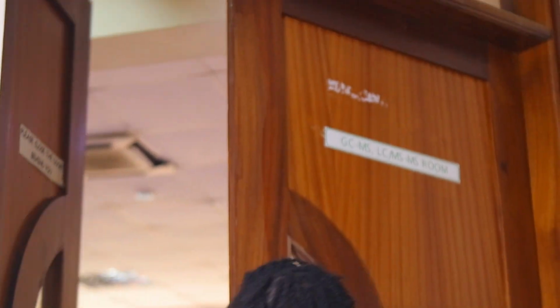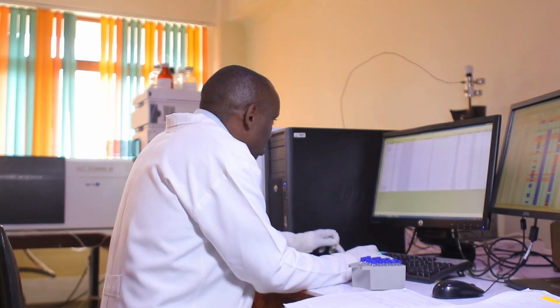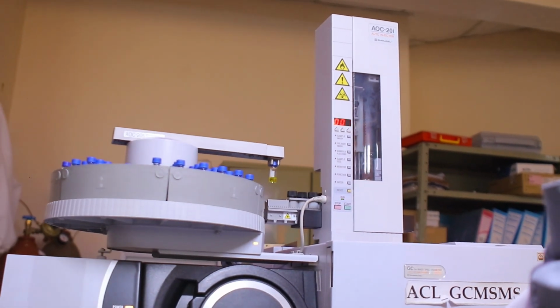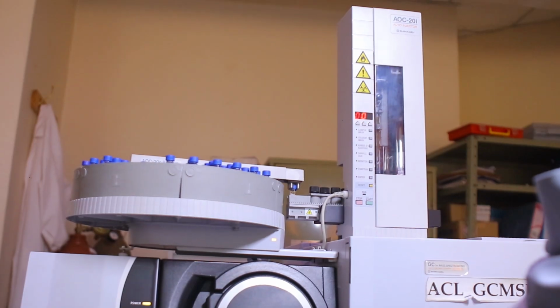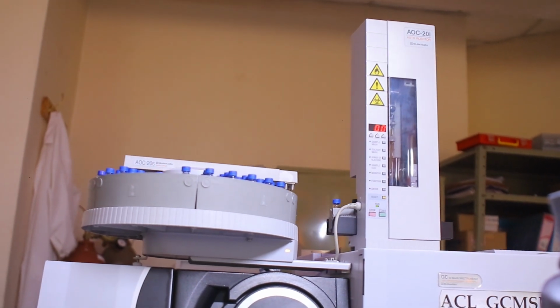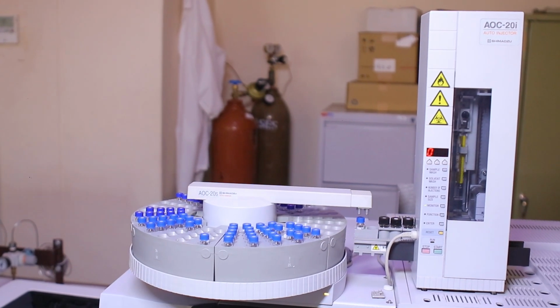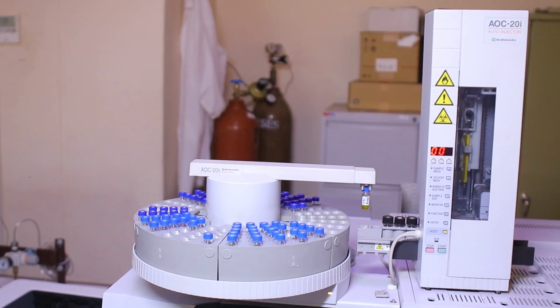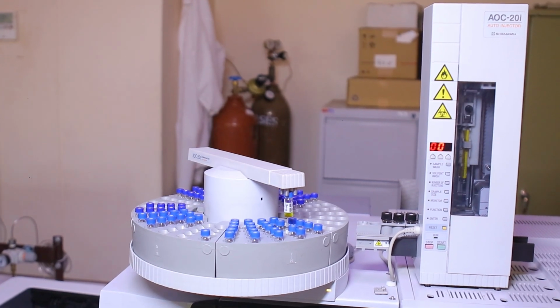Pesticide residue analysis is very important because it helps in access to the international and local market. Therefore, when we carry out that analysis, we support access to the international market. The scope of analysis is 400 molecules for liquid chromatography mass spectrometry, and for gas chromatography we have around 300 molecules. In total, we analyze around 700 molecules, which is important because those are some of the pesticides used by our farmers.